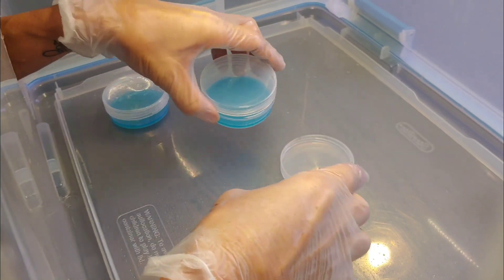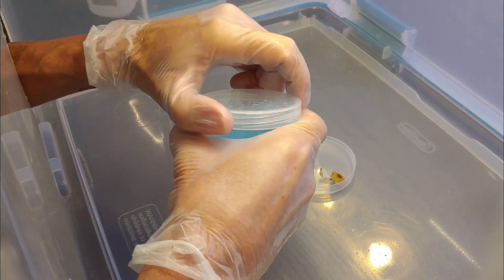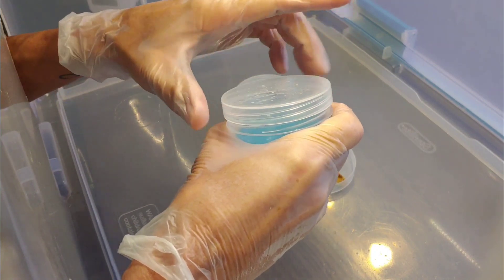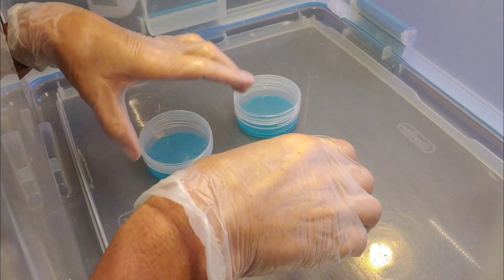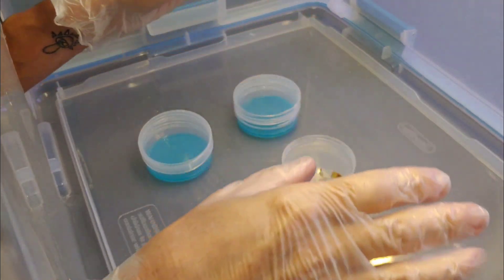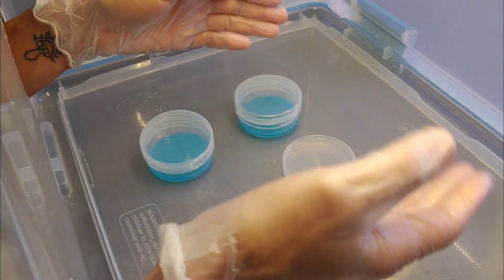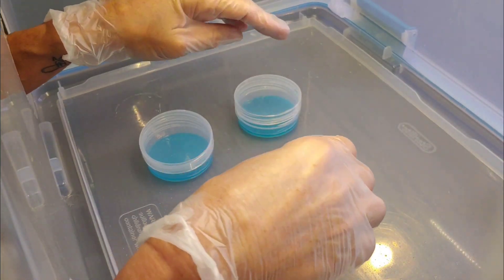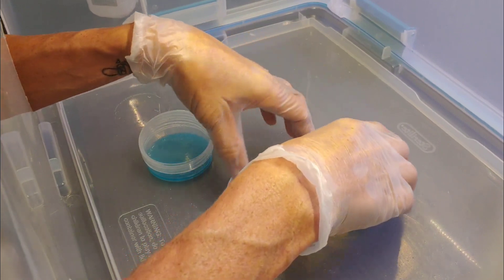I am going to try on two in case one of them gets contamination. Hopefully, out of the two, we can get one and then if we do get contamination, we can transfer from one agar cup to another one and start cleaning it out.